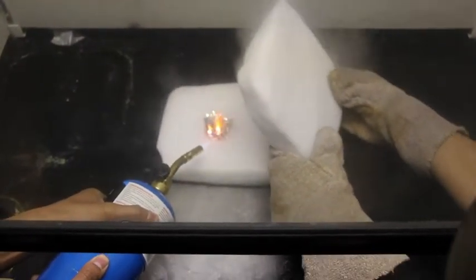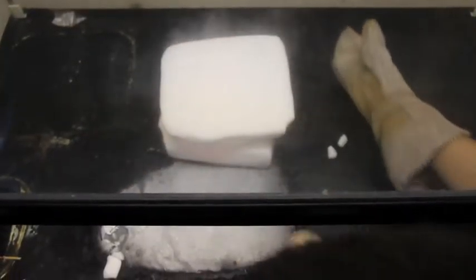Lay it. No? Yeah. No? No. No. Oh! Is it gonna explode? About turn off the light. This light? Mm-hmm. Oh. Small. Oh, it died. It died, no! Lame. What was it supposed to do? Take it off. Yeah. Restart it.